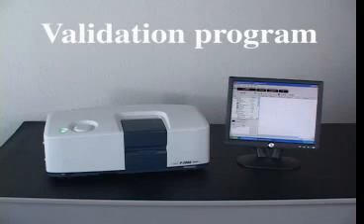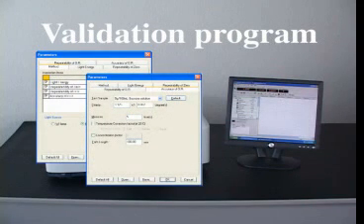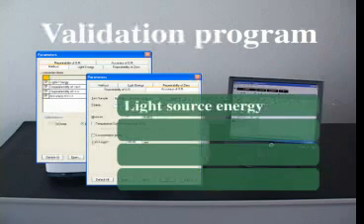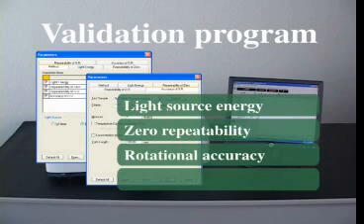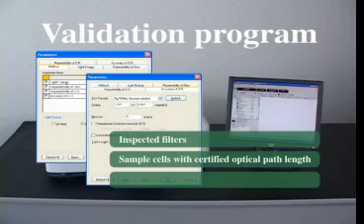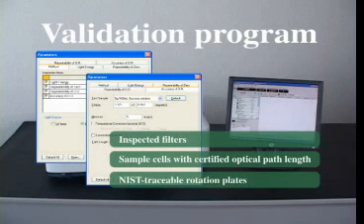An automated validation program is available for GLP and CGMP laboratories, or those regulated by the FDA. The program can be used for periodic validation of light source energy, zero repeatability, and rotational accuracy and repeatability. Inspected filters, sample cells with certified optical path length, and NIST traceable rotation standards are also available.